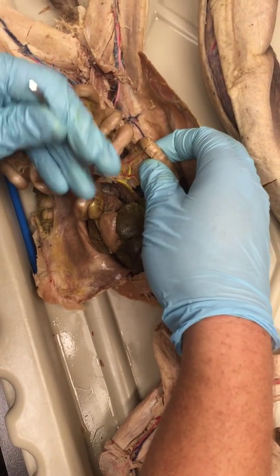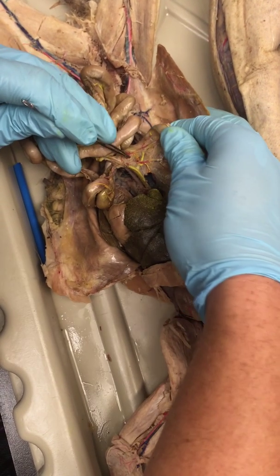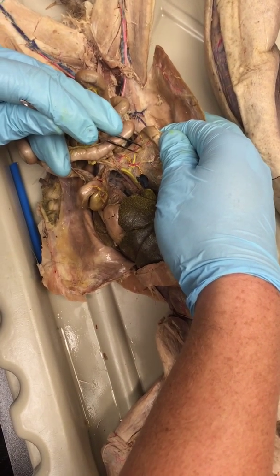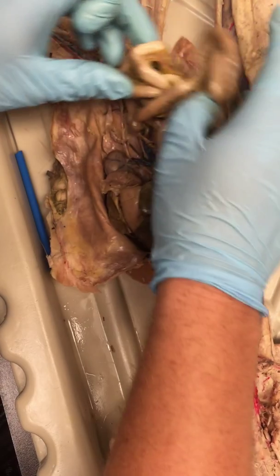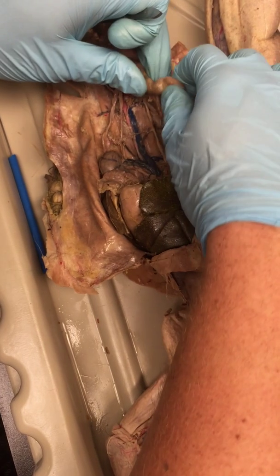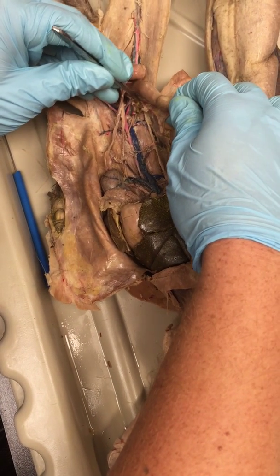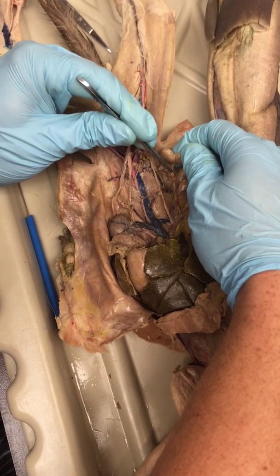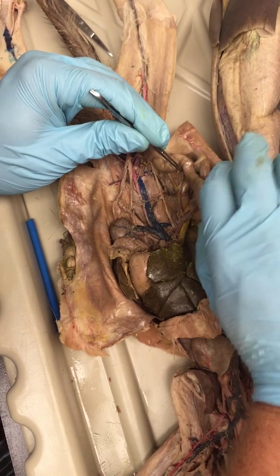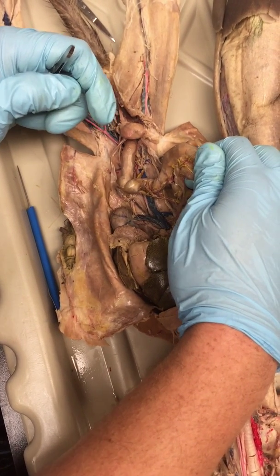Now, the superior mesenteric also branches into this guy. So see here, there's the superior mesenteric there, and it branches up here into the posterior pancreaticoduodenal. The vein does the same thing. Now, let's go back down to the large intestine. This is sort of cut, and I'm very sorry about that, but this would be the left colic right here. The middle colic would sort of be this one that connects up here. And then we have the really tough one, the right colic and the ileocolic.